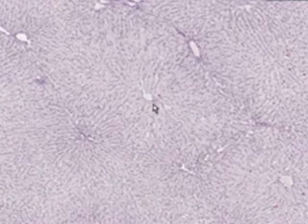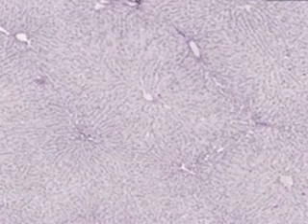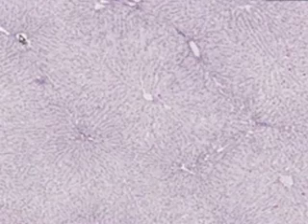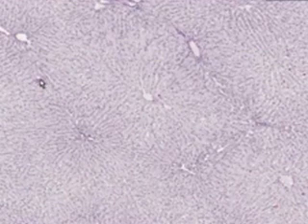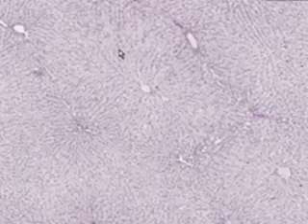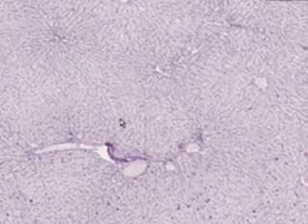So here's a central vein. Here's a sinusoid opening up into a central vein. Here's a portal vein because it has connective tissue and a bile duct and maybe a little artery. Here's a portal vein because it's bigger and it looks like it has some connective tissue. Maybe we'll find a little portal hepatic artery and a bile duct here. Here's a portal vein here. Here's probably a portal vein. Here's definitely a portal vein because you could see connective tissue. Here's definitely a big portal vein because you could see the artery here and the bile duct here.